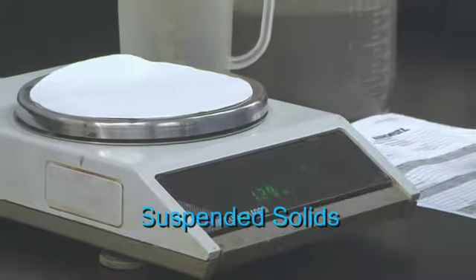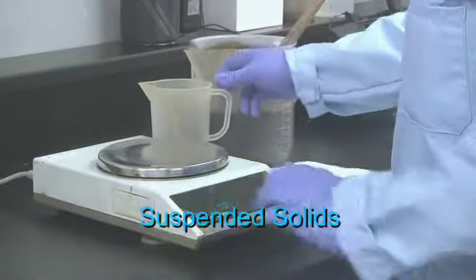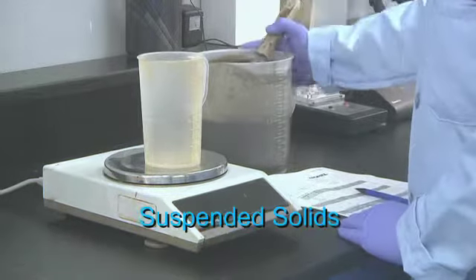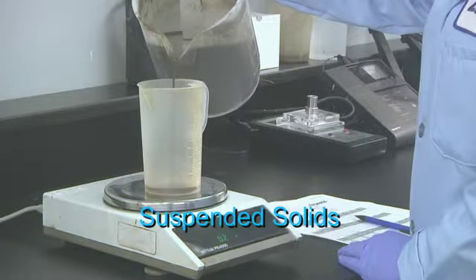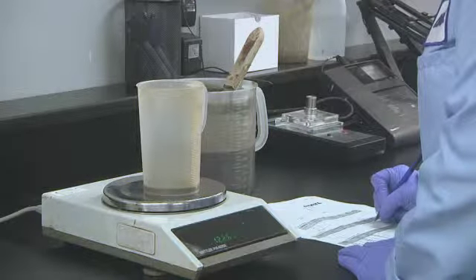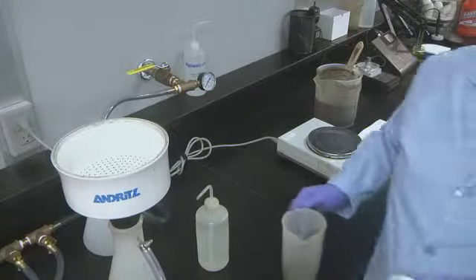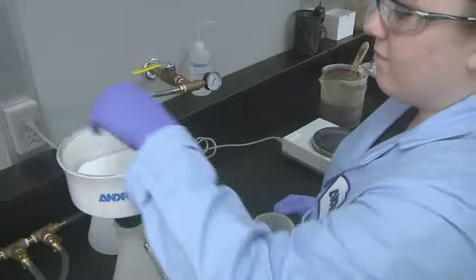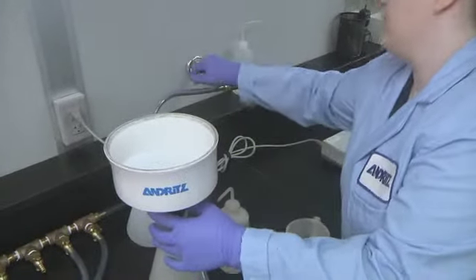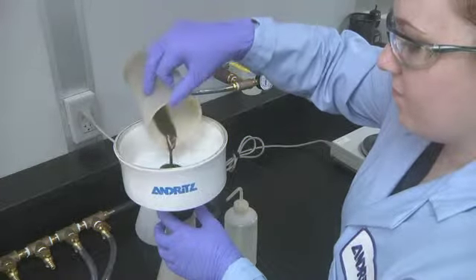A well-mixed sample is filtered through a weighed standard glass fiber filter. The residue, retained on the filter, is dried to a constant weight at 103 to 105 degrees centigrade. The increase in weight of the filter represents the total suspended solids.